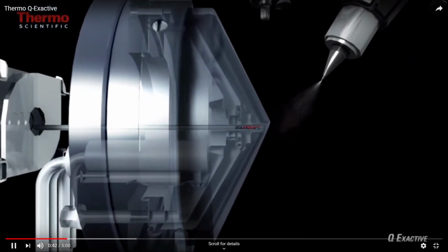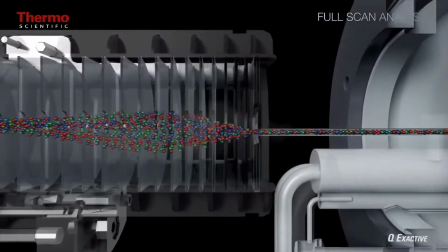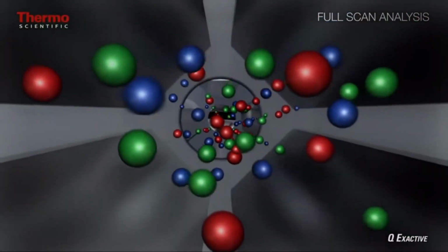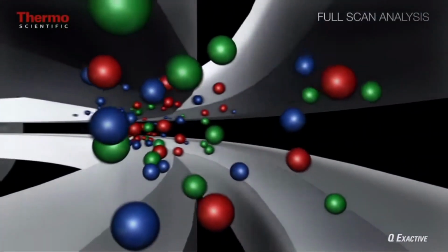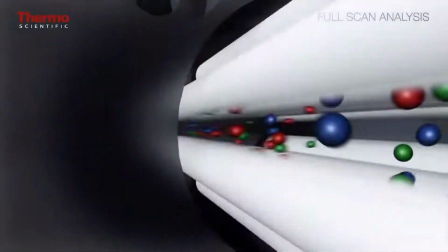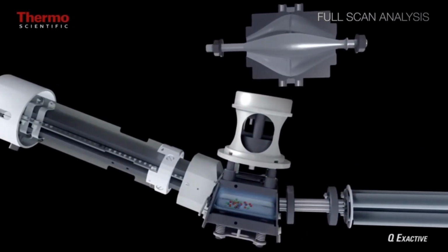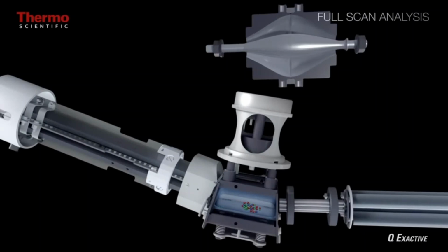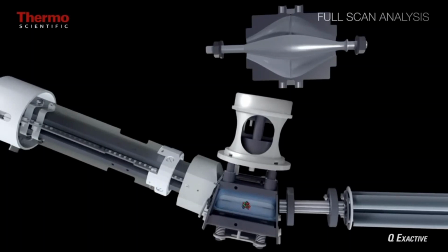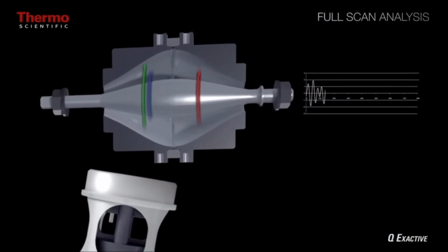So we see our analytes being ionized. They're traveling into the mass spec through the heated capillary. These different species are visualized as different colors, passing through a series of lenses. And they're going to travel around the curved flatapole and pass through the mass filter. Now at this point you can choose different M over Z ranges that you would actually like to submit for further analyses. The length of time that you collect these ions, this is a parameter that you could experiment with. And then these will be submitted to the Orbitrap momentarily, where we'll actually be able to get the M over Z ratios of these precursor ions.